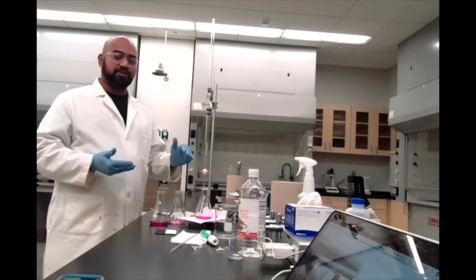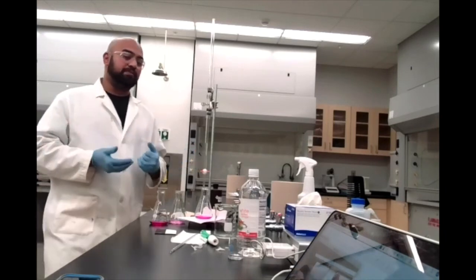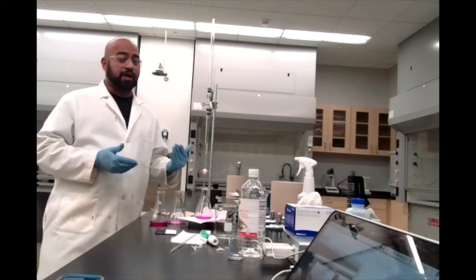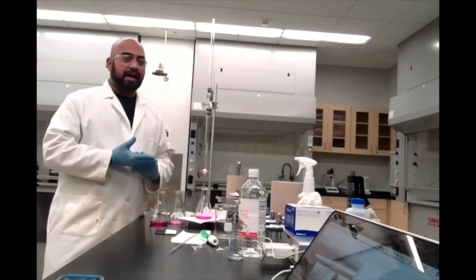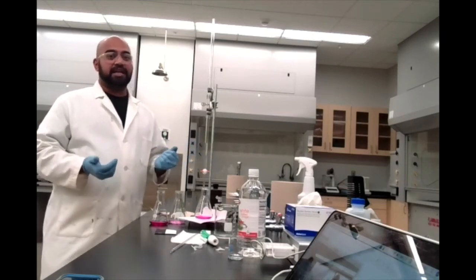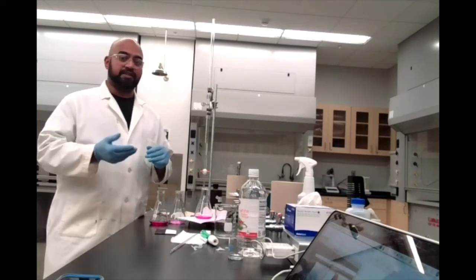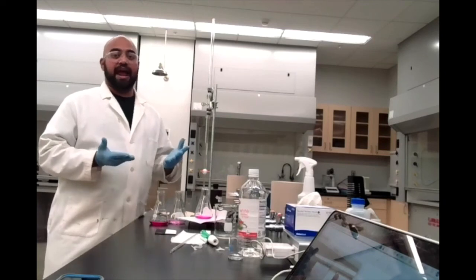The 3 trials we took are very similar to each other. So even though we didn't know where the endpoint was, I was careful enough in that first trial that I think you can trust it and include it in your average. I mean, you could also throw that one out and just use trials 2 and 3 for your average, and that's fine. But like I said, if you keep that first trial like the instructions say you should, you'll still get a relatively similar answer.